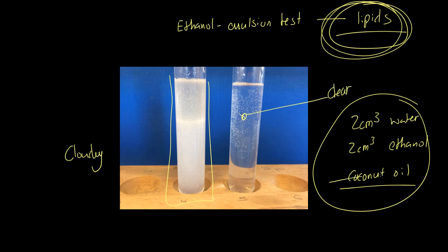This clear example here, this one is clear. We have not used something fat-based. Basically what we're saying is we've got no lipids present whatsoever. So it could be that we've used a food sample that has no lipids, and we've tested for that, and it proves there are no lipids present. That's our reagents.